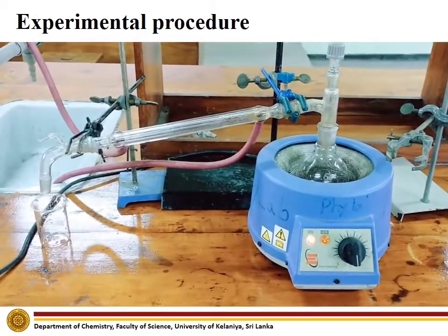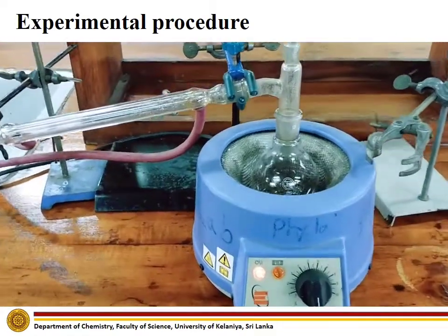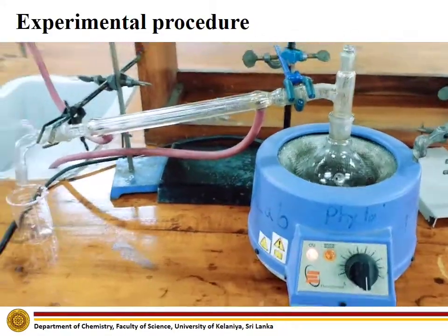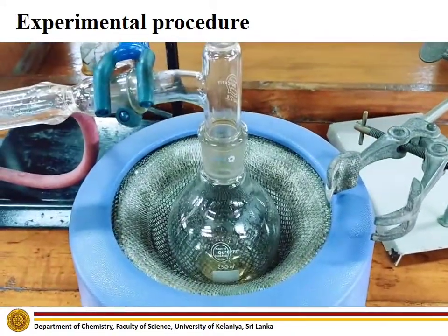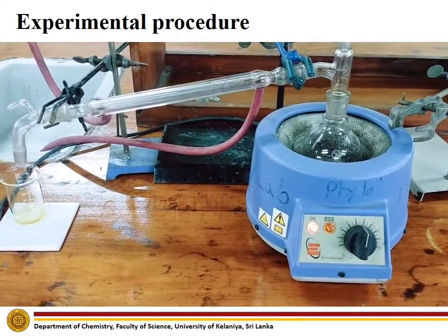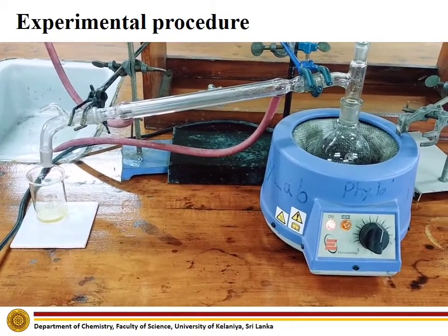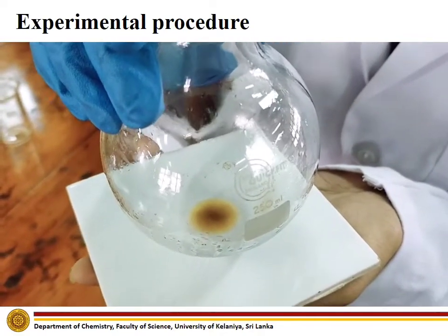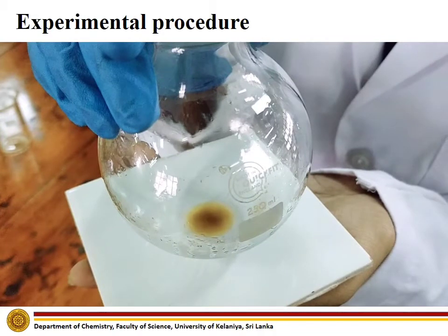Arrange the distillation setup as shown. Continue the distillation process until all the solvent has been collected into the beaker, then turn off the setup. Finally, the clove oil remaining in the round bottom flask can be observed.